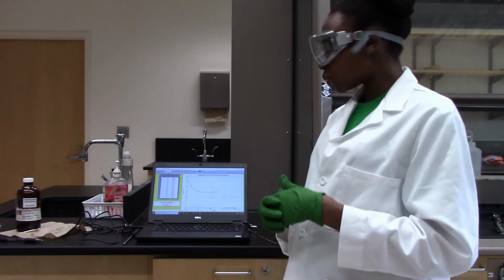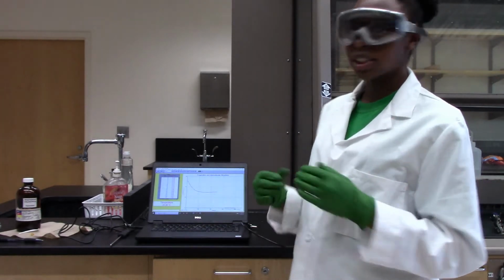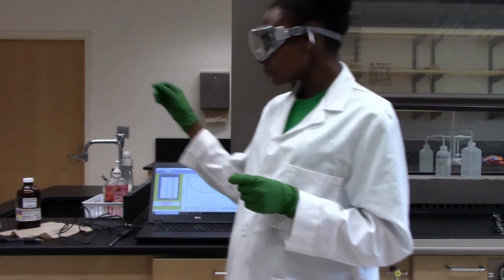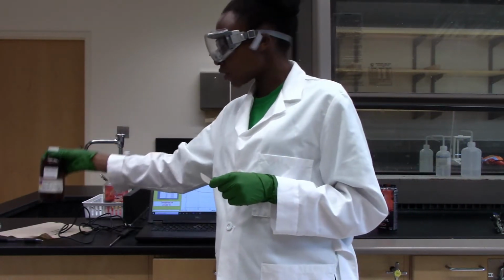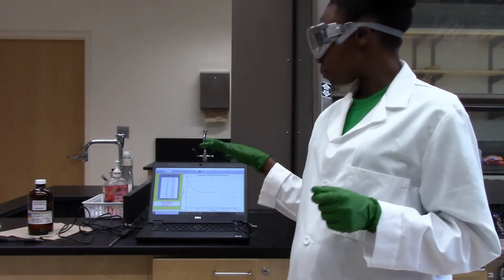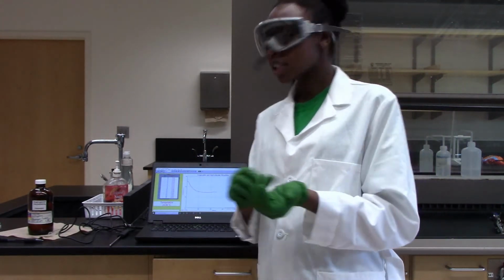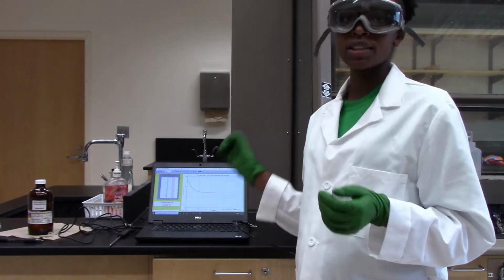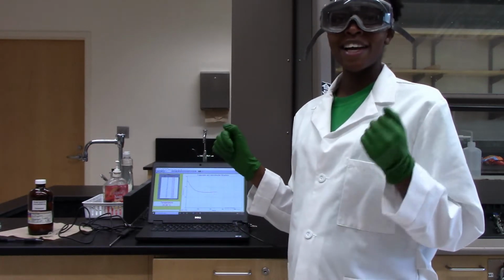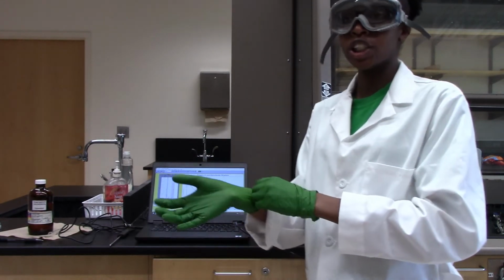So for this experiment, we have here our temperature probe that will enable us to take our initial and final temperatures. We also have the filter paper that we will insert into the liquid. And I have isopropanol, which is one of the 7 compounds we are testing today. And then we will use Logger Pro to monitor the temperature changes. So once you receive your Logger Pro graph, you should be able to use the statistics button right there and find your initial temperature and final temperature, then subtract to get your change in temperature.